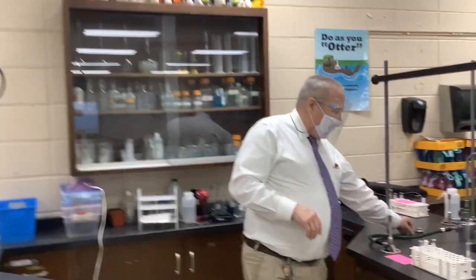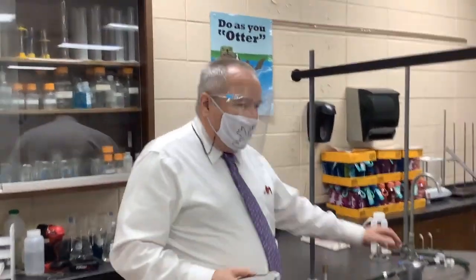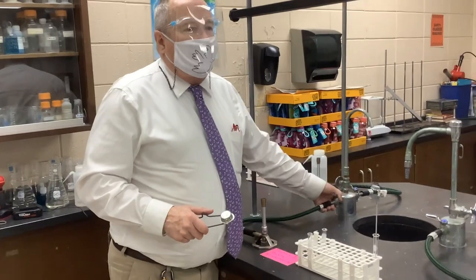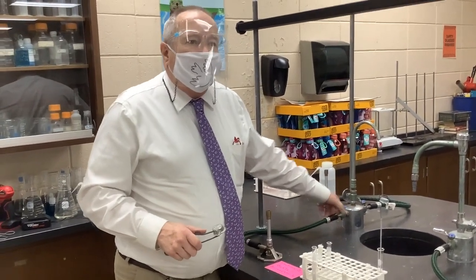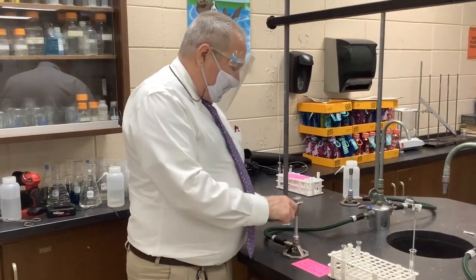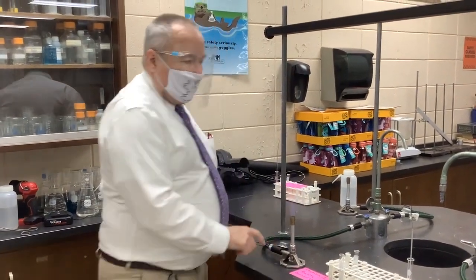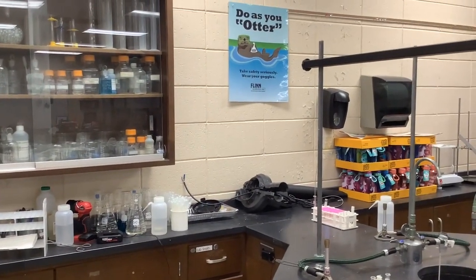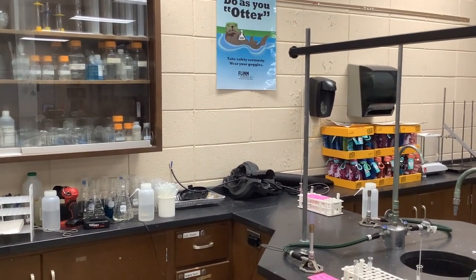Actually, I'm going to turn this on, and I'm going to go turn those lights off again because the colors are more vivid when it's a little darker. So I'm turning my gas on and lighting my Bunsen burner. I'll be right back. We haven't learned to pause or video edit yet.